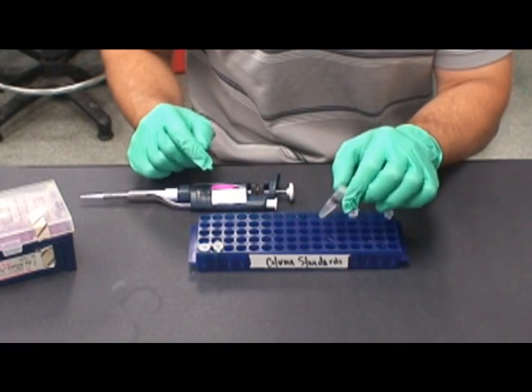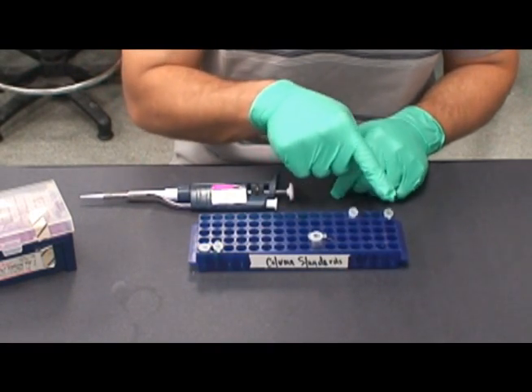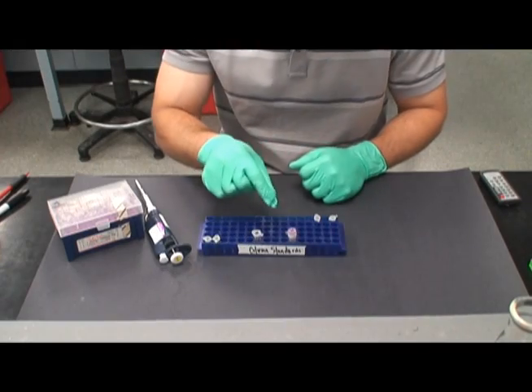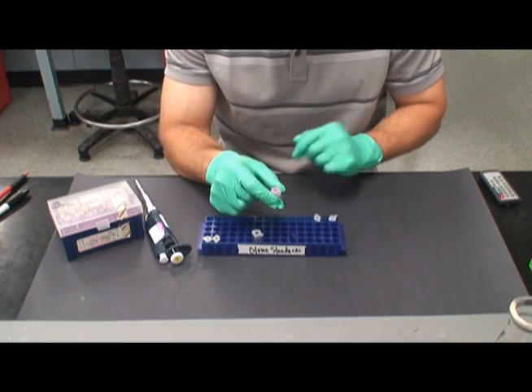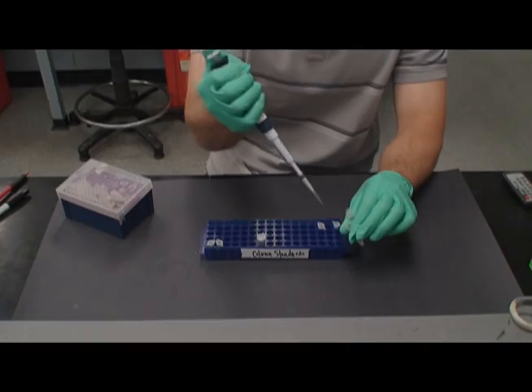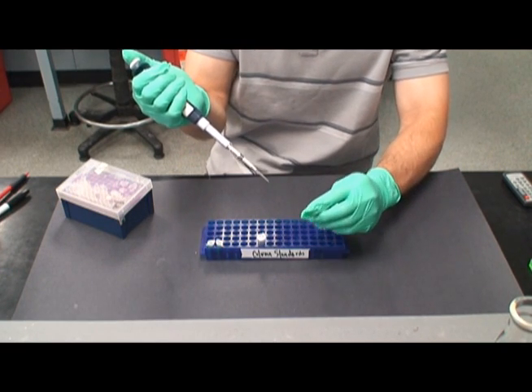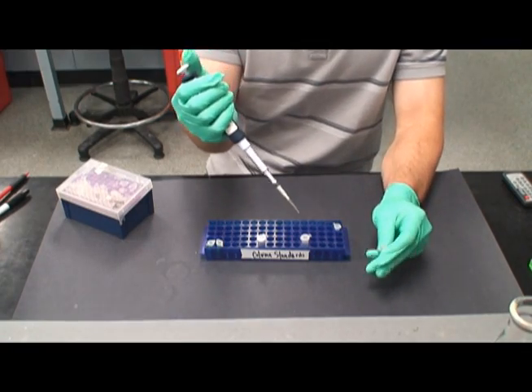Obtained from a previous lab or the instructor, 10 microliters of plasmid DNA is placed into each of the two microfuge tubes. As done before, 2 microliters of 10x fast digest is added to each of the two tubes. Next, 6 microliters of sterile water is added to both tubes. The contents are also mixed by flushing up and down a sterile pipette.